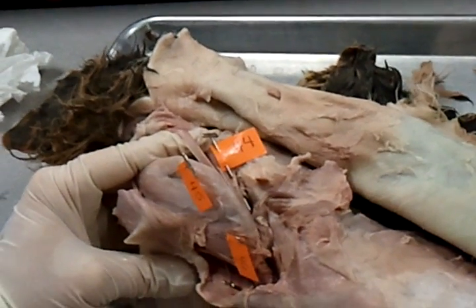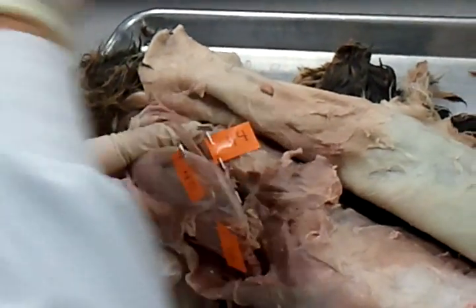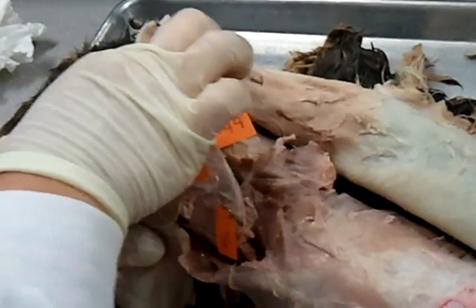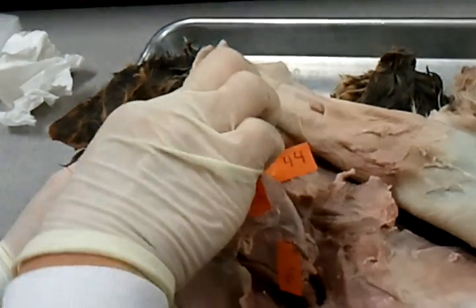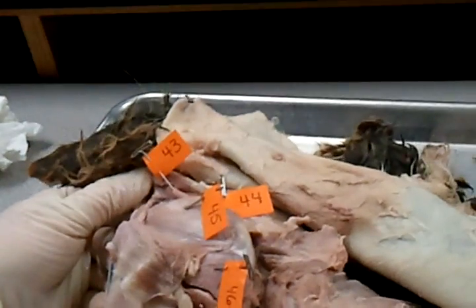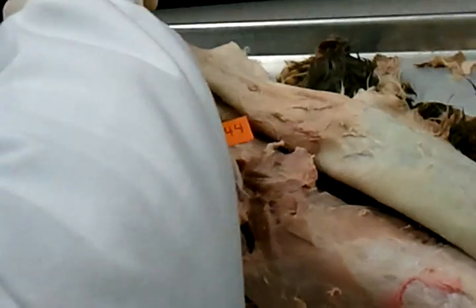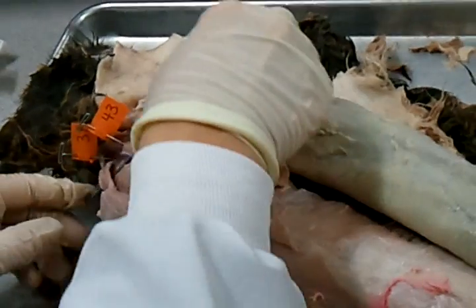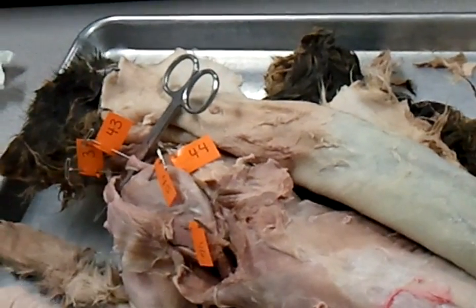Levator scapulae, or the levator scapulae dorsalis. Take a look at the levator scapulae ventralis — it's a little thicker. It's got a little fat hanging off with the coracobrachialis. See how they both go way up into the neck? So I've got the levator scapulae dorsalis and ventralis — they go to the occipital bone, way up in the neck. Levator scapulae ventralis was number thirty-seven. Those two go way up into the neck — pointing out the obvious is always very helpful.